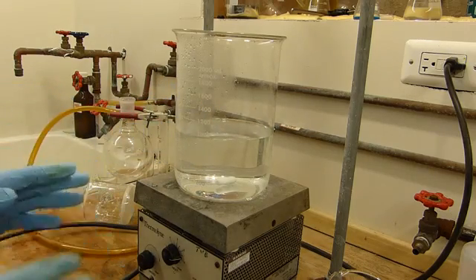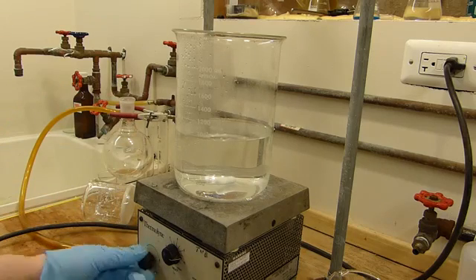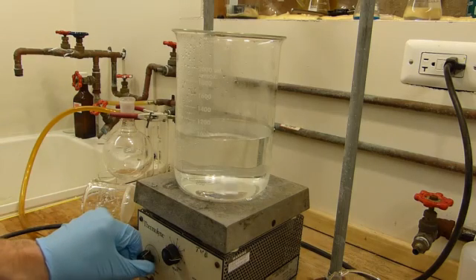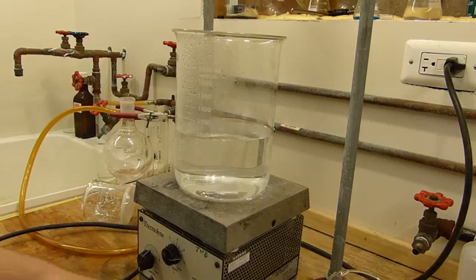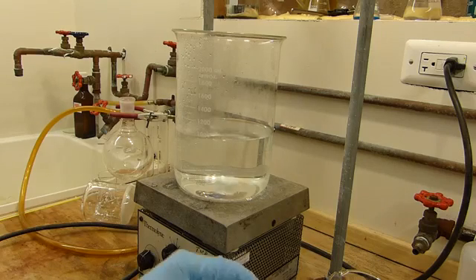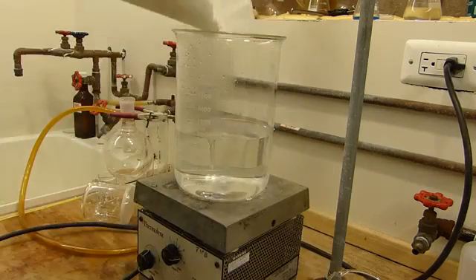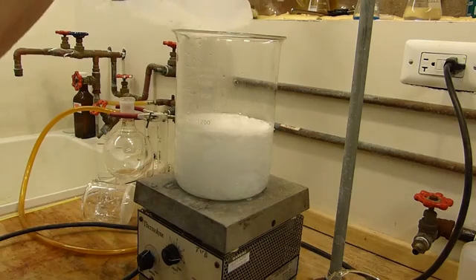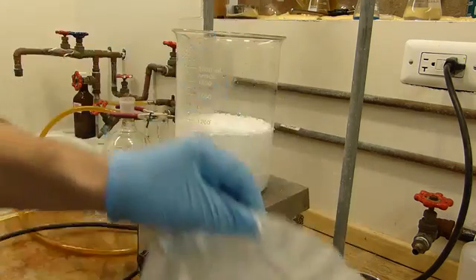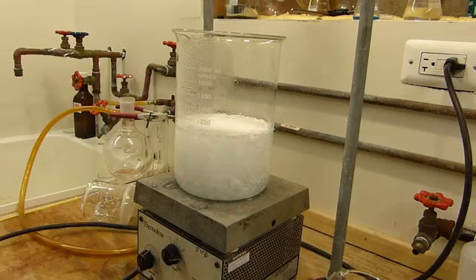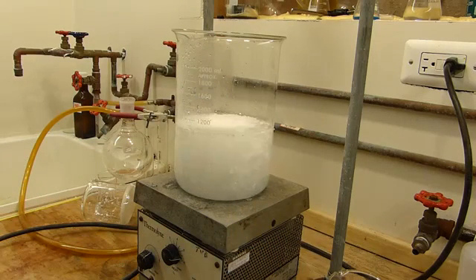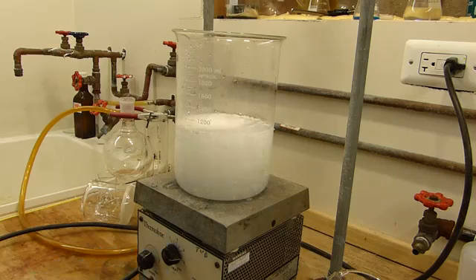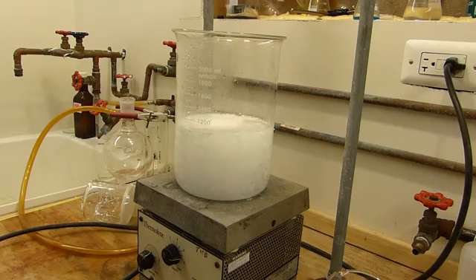And I'll just get this boiling, make sure it all dissolves, and then we'll stick it in the freezer. So we'll get the stir bar going. And we'll drop in the benzoic acid. And with heating and rapid agitation, we should be able to get all of that to dissolve in the course of a few minutes.